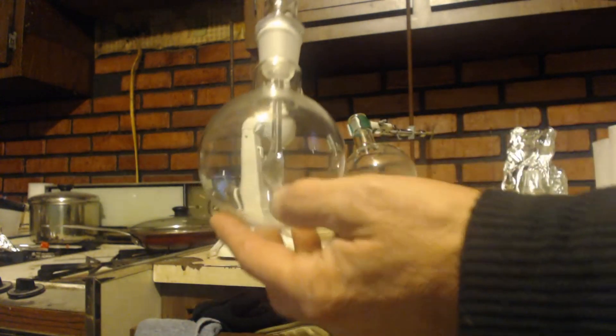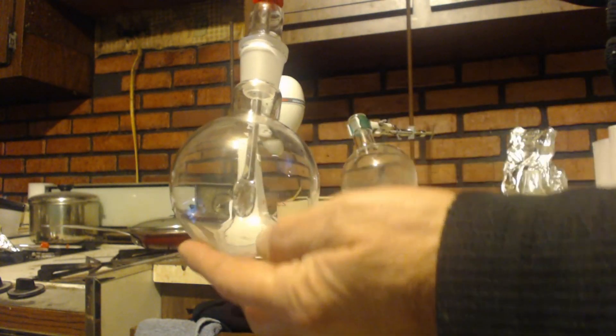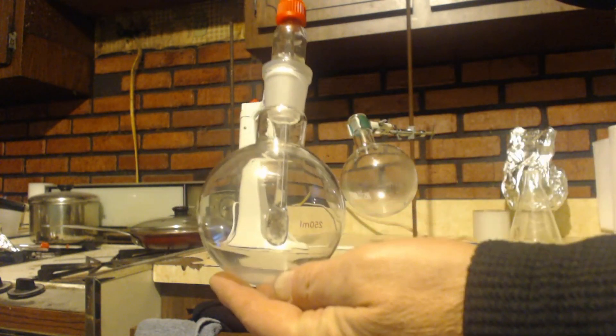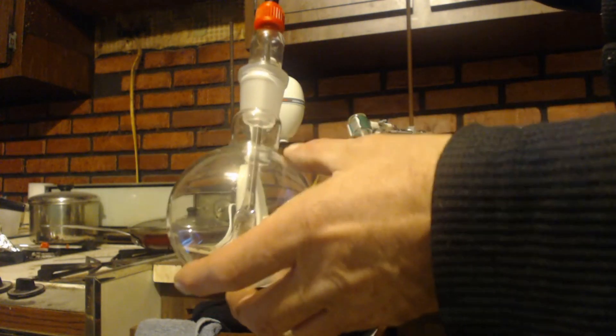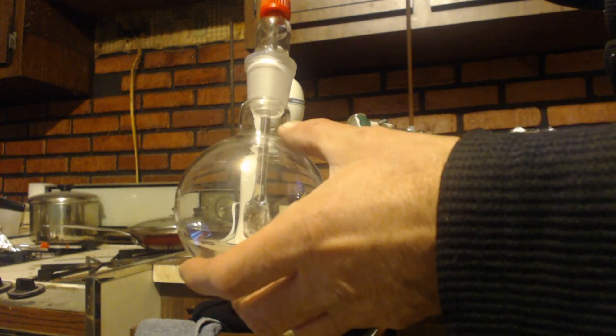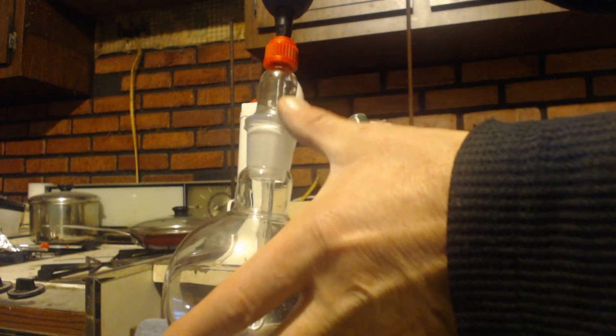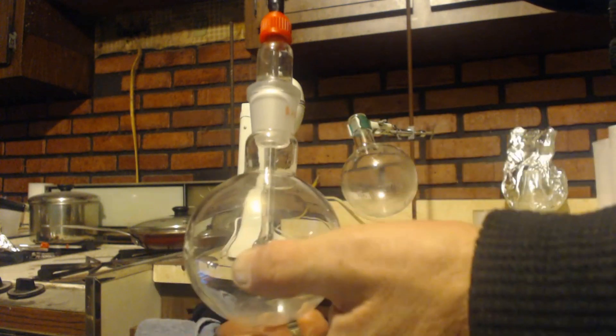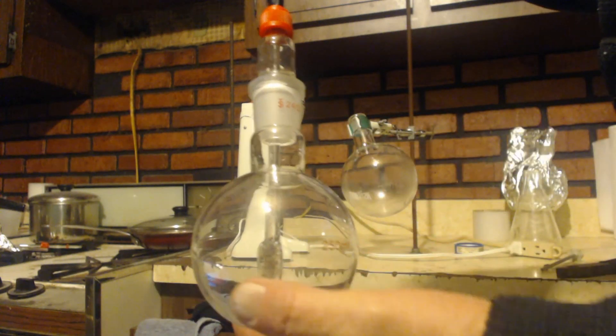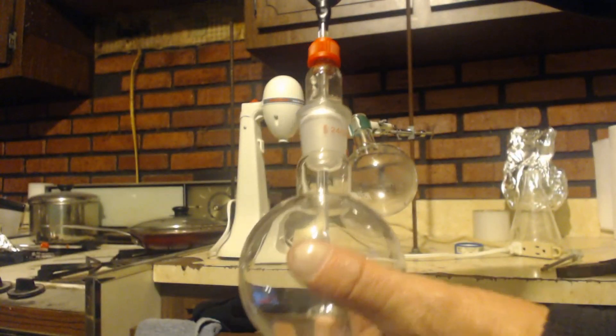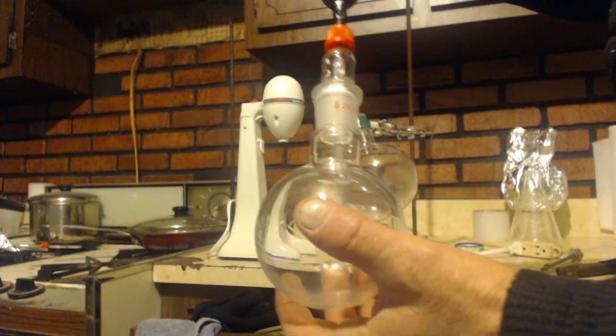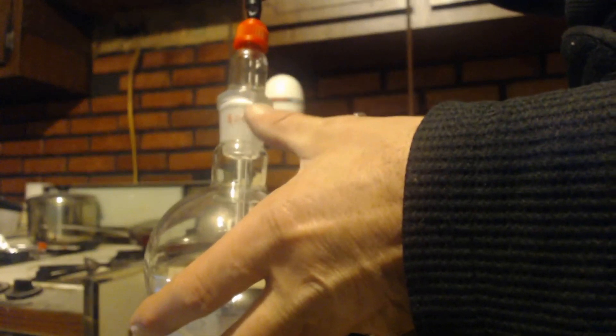And when your stir rod came down all the way to the bottom there, it doesn't interfere with anything because your condenser is just a tube just like this is a tube. If anything, it'll increase the efficiency of your condenser because it has more area now for the vapor to condense onto.